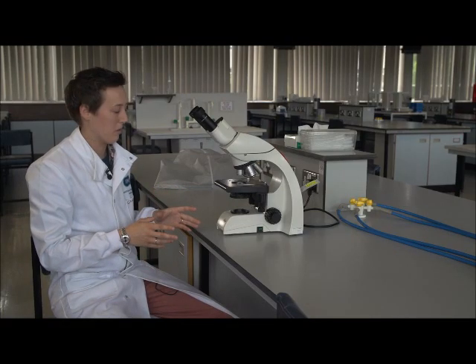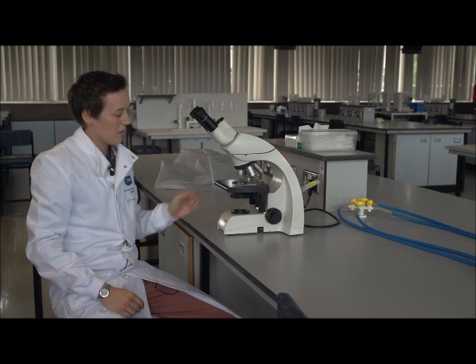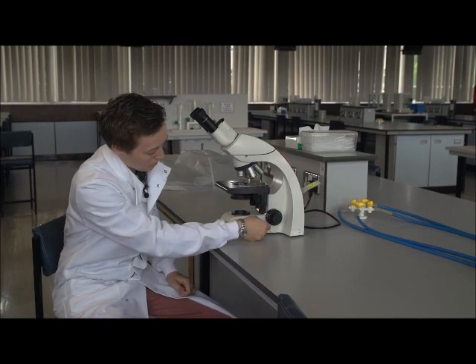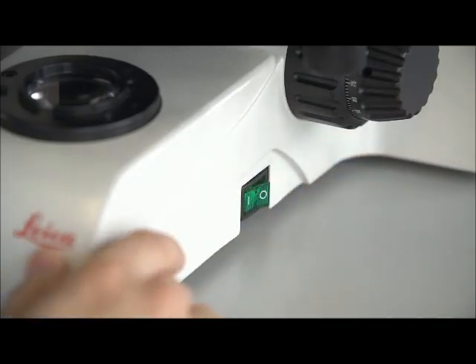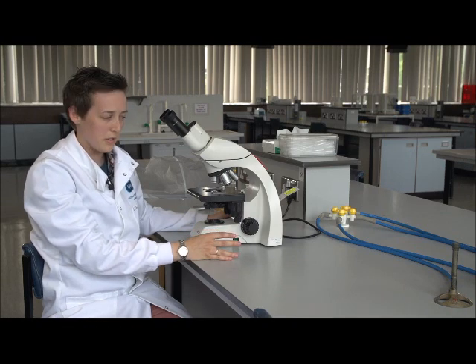Before we switch on the microscope, we want to make sure that the light level on this left hand side is down to its lowest point, and then we want to switch on this right side. And now the microscope's ready to use. What I'm going to do now is show you how to make a basic wet mount slide.